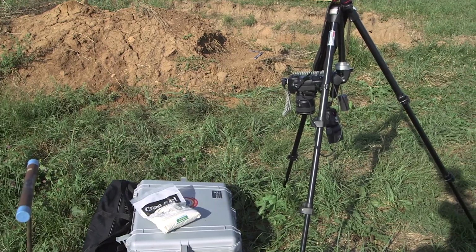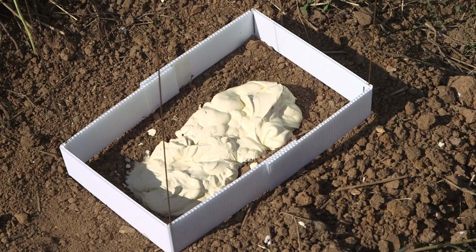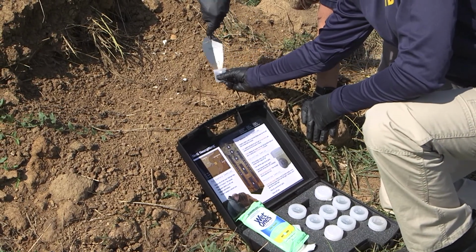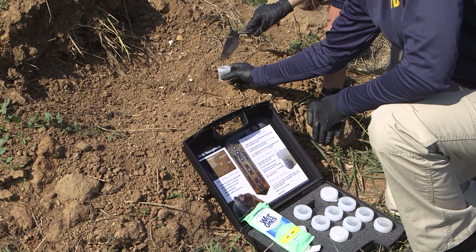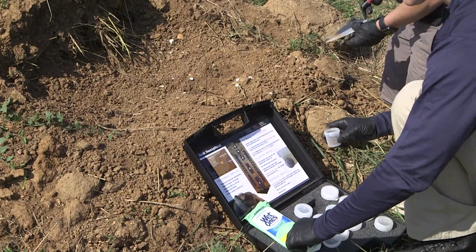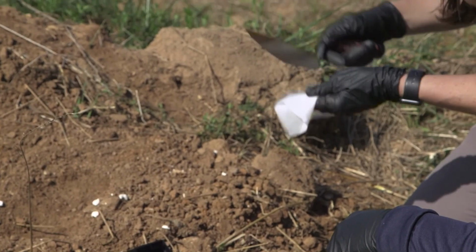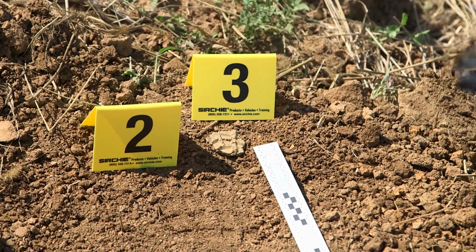After documenting the impression with photography and/or casting, collect soil in or immediately adjacent to the impression, capturing all apparent variation. Also, collect any foreign soil as a separate sample. If soils are moist, cover them with porous paper like a coffee filter or lab wipe and allow it to dry in a secure and clean environment. Package soil aggregates to preserve structures present.